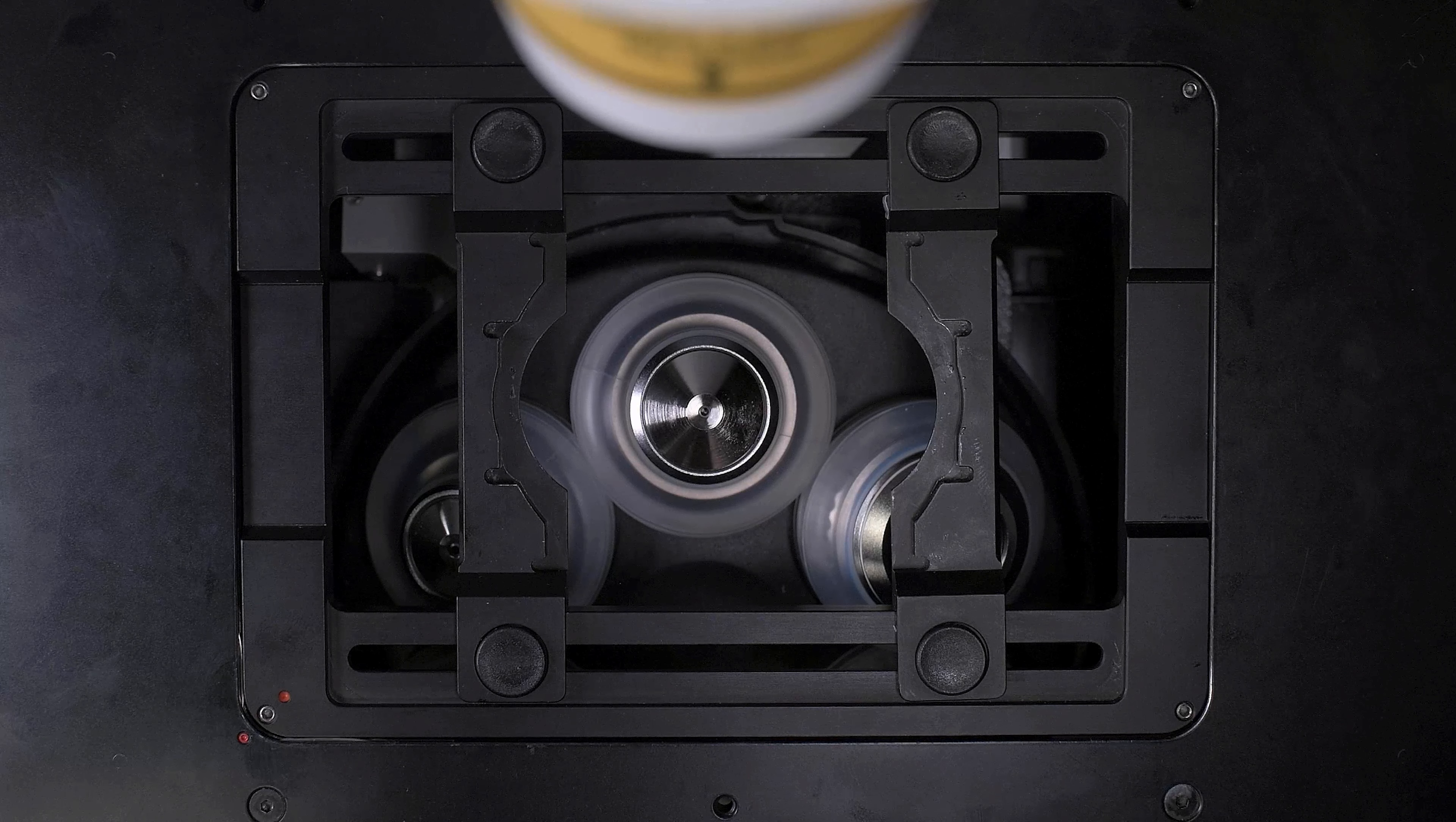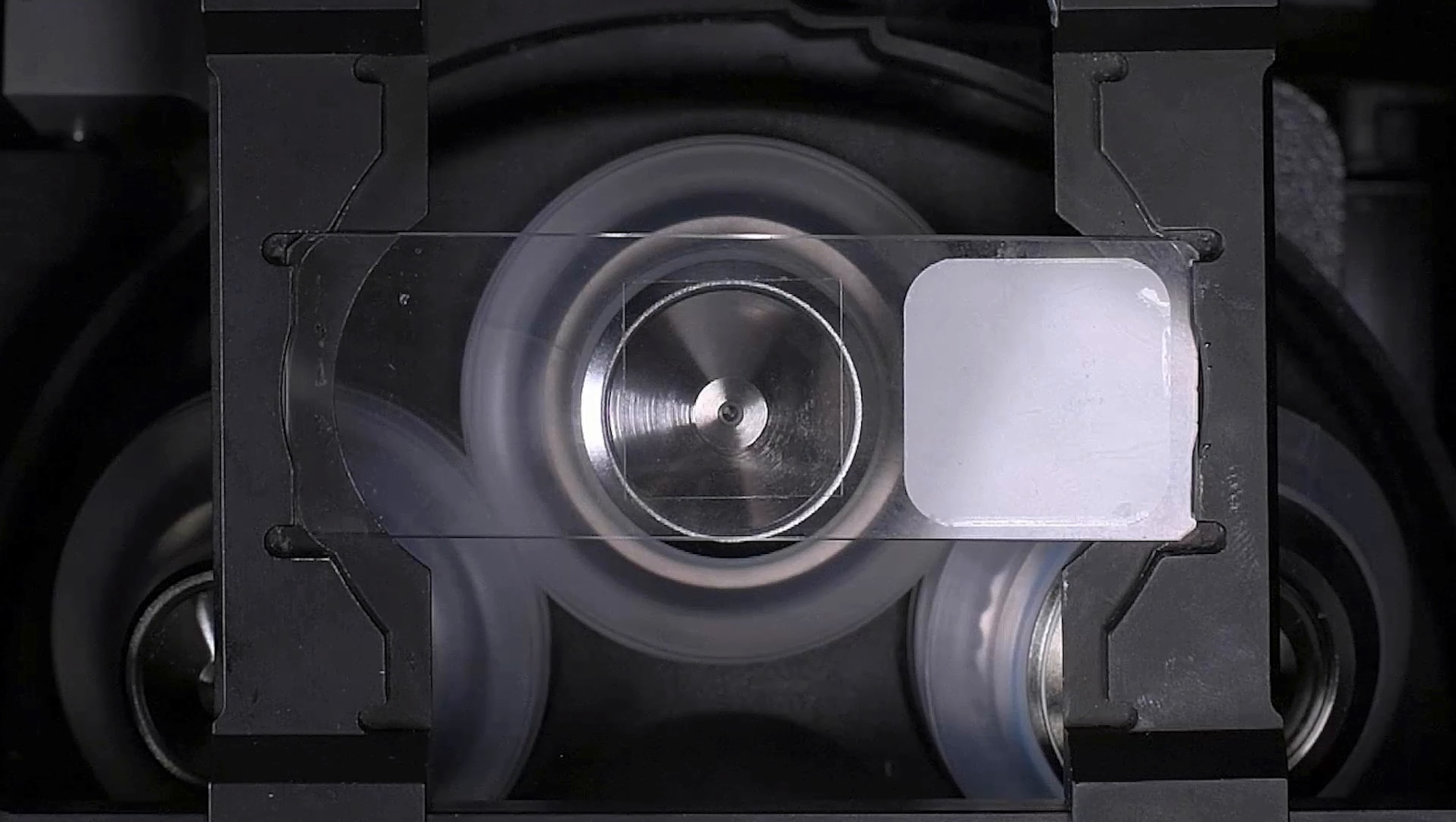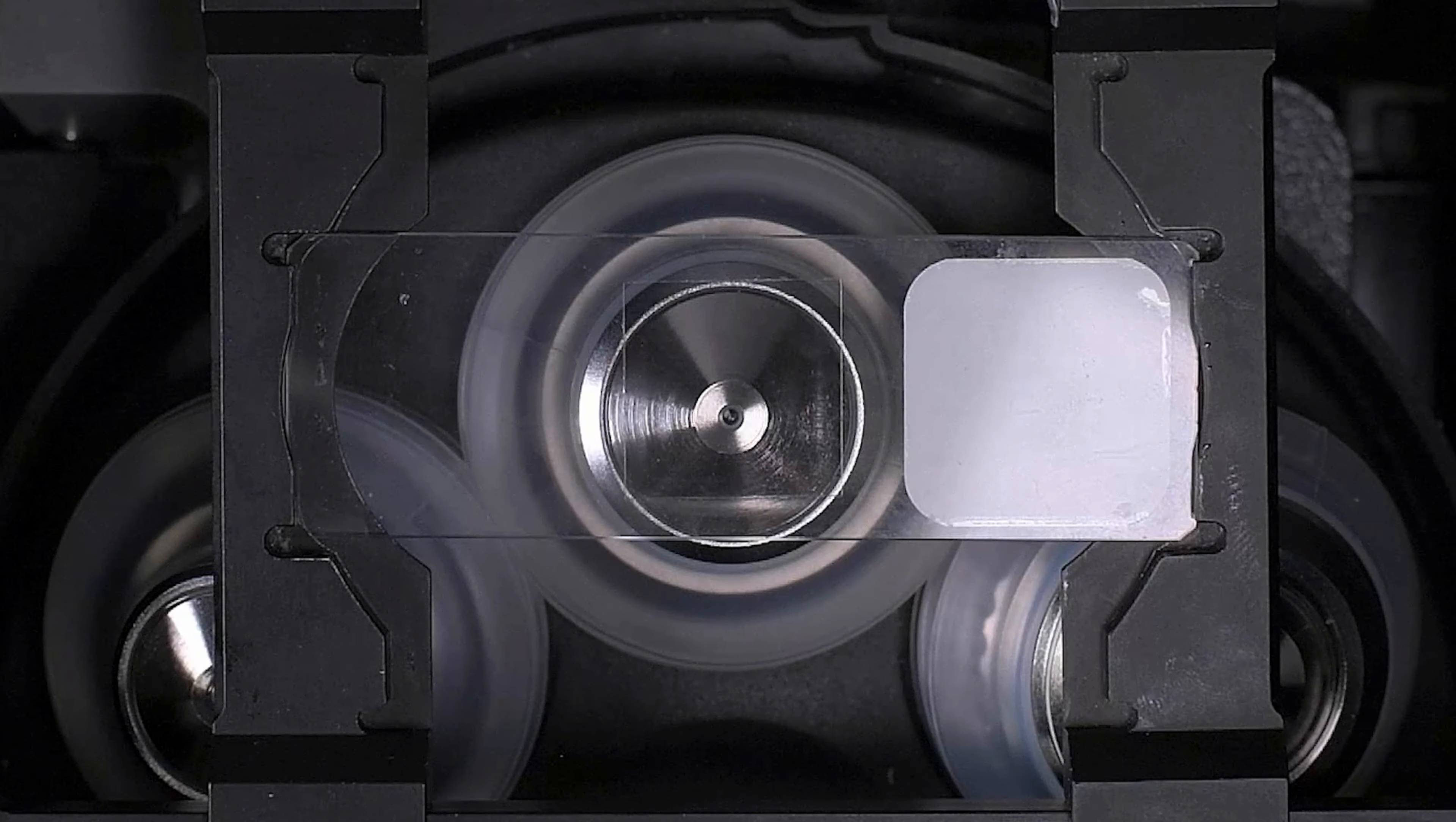If you had enough oil to cover the outer reservoir on the last slide, do not apply additional oil to the new slide. There is plenty of immersion fluid left on the objective to image another slide. Place the new slide into the sample holder and position the stage. Repeat the steps outlined earlier for sample focusing. Only apply a new bead of oil to every other sample in your series. Always make sure that for each slide, you only have enough oil to cover the oil reservoir.